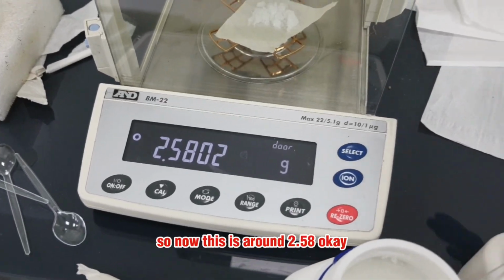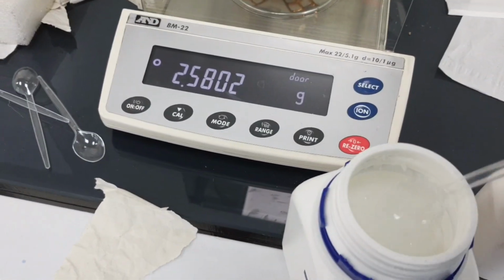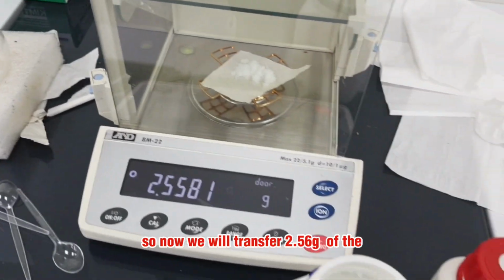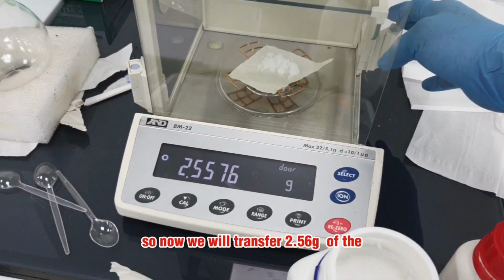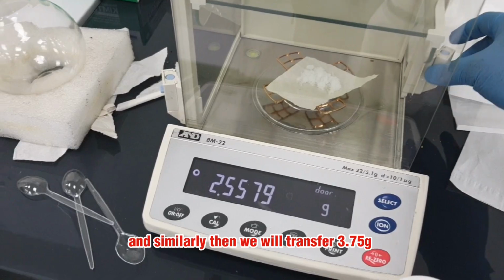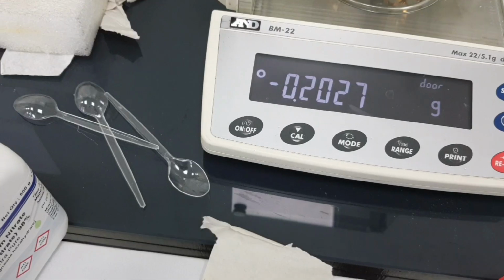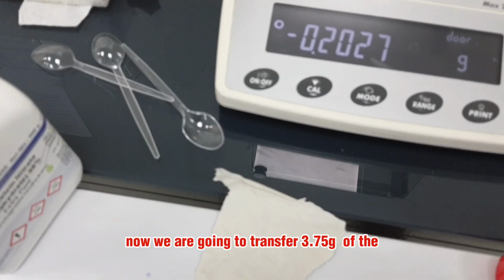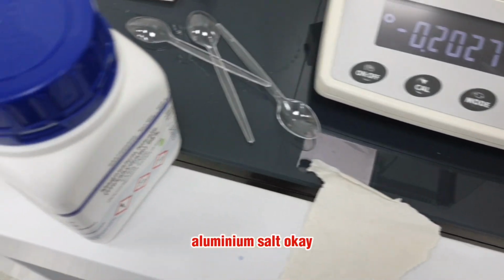Now this is around 2.58, and we have to make it up to 2.56. So now we will transfer 2.56 gram of the magnesium salt, and similarly we will transfer 3.75 grams of the aluminum salt.